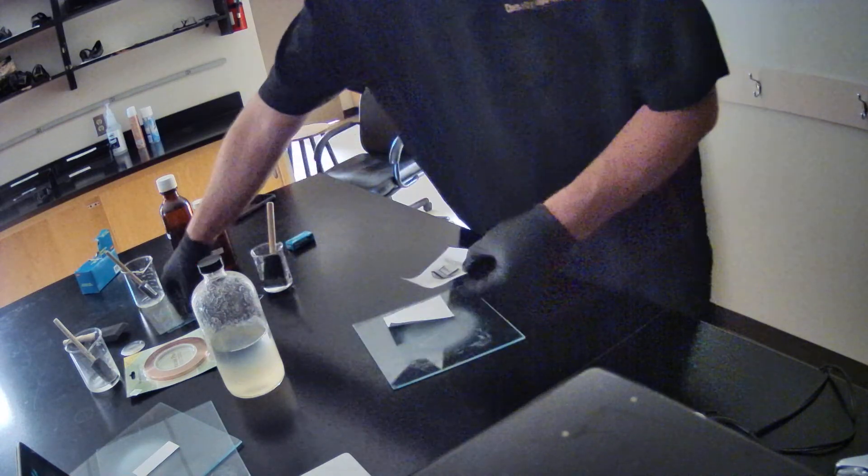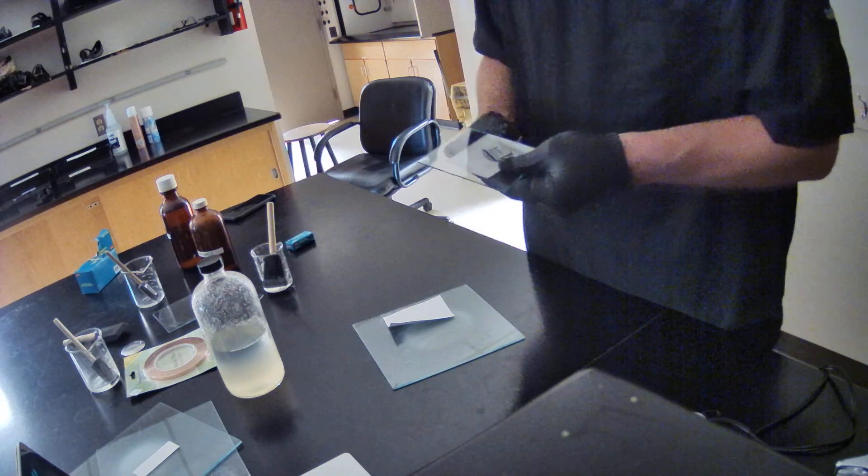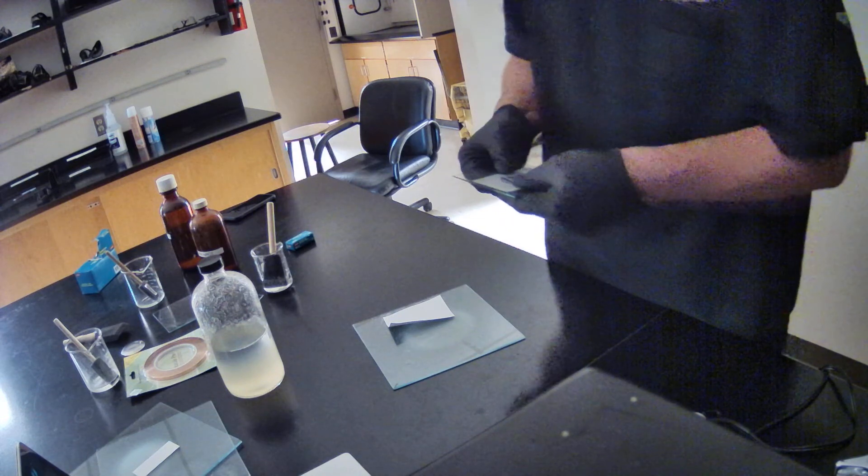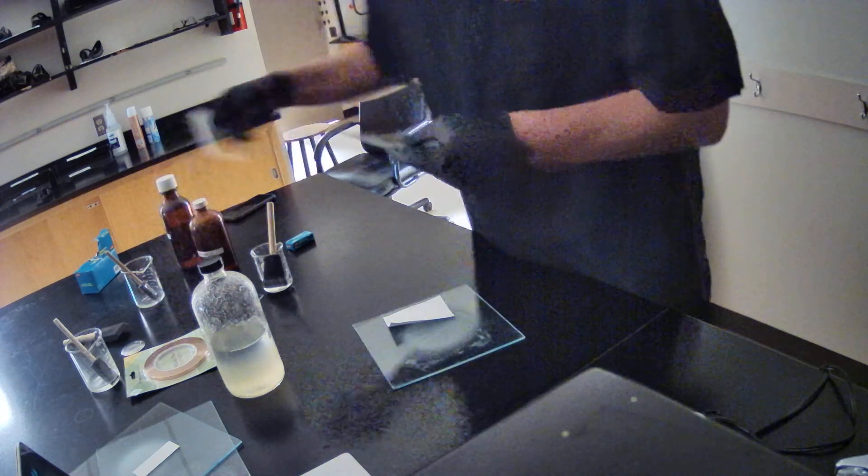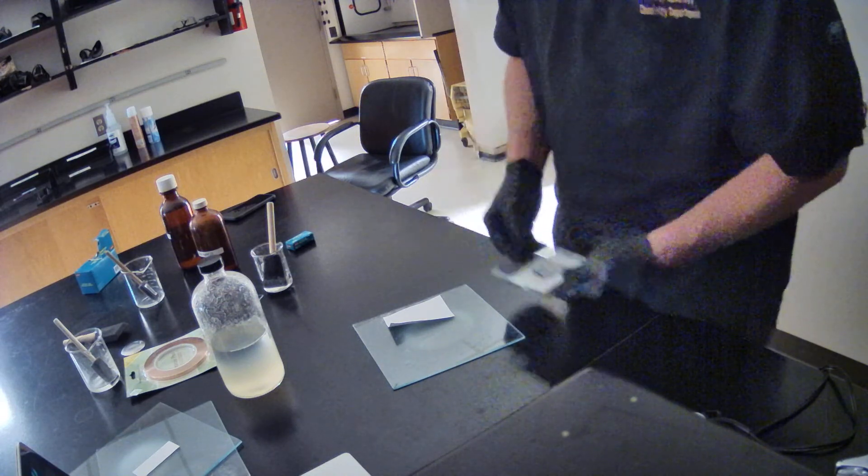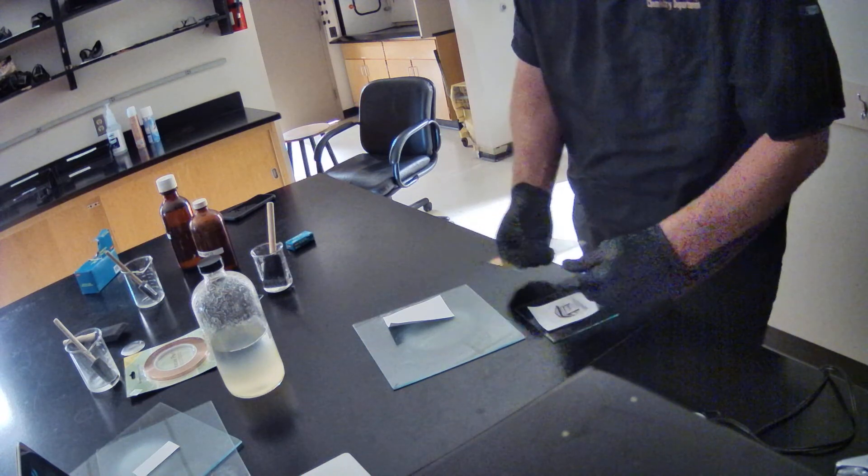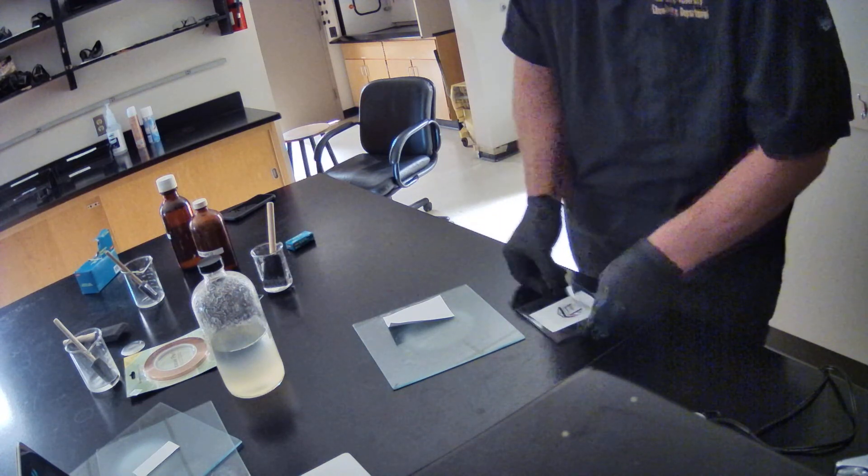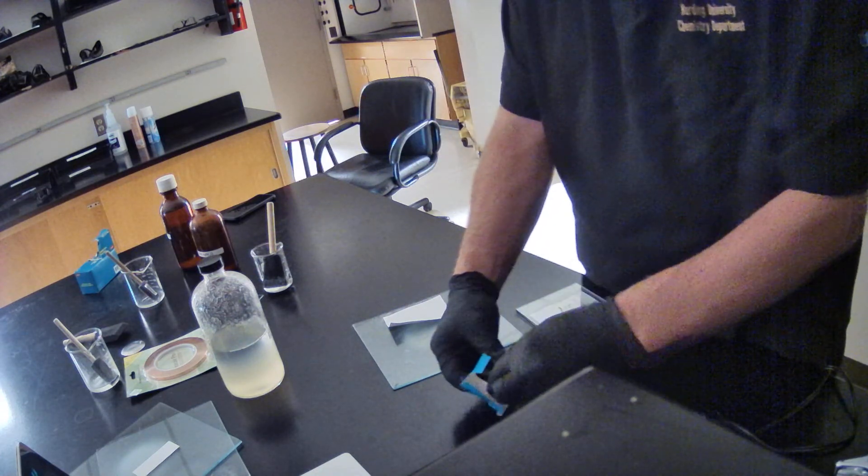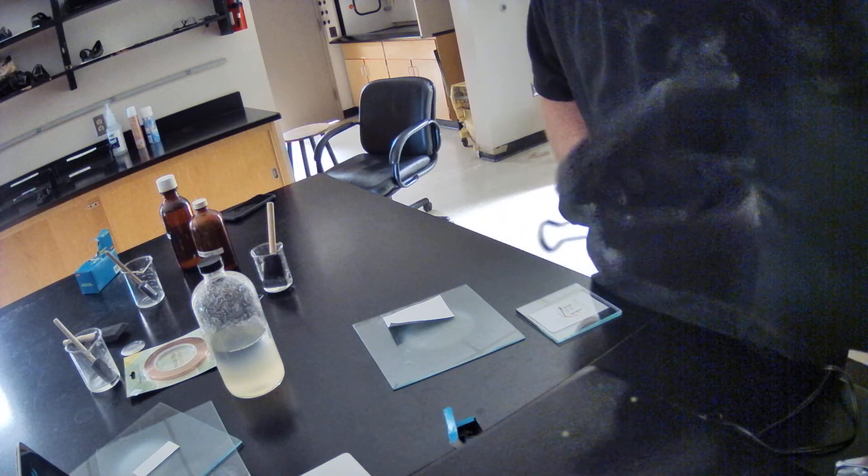And I'm going to make a sandwich using these glass plates, okay? And I'm going to hold everything in position using binder clips. Now these tiny little binder clips here, the same ones you use for holding paper together.